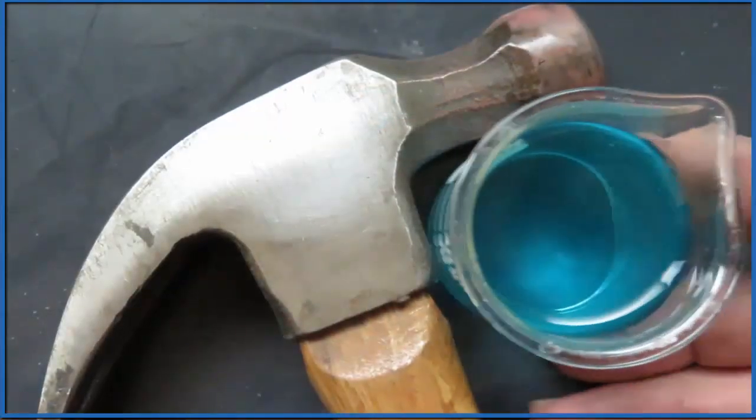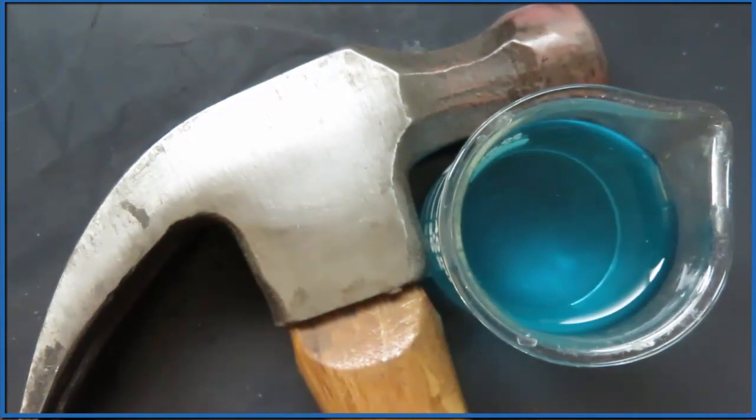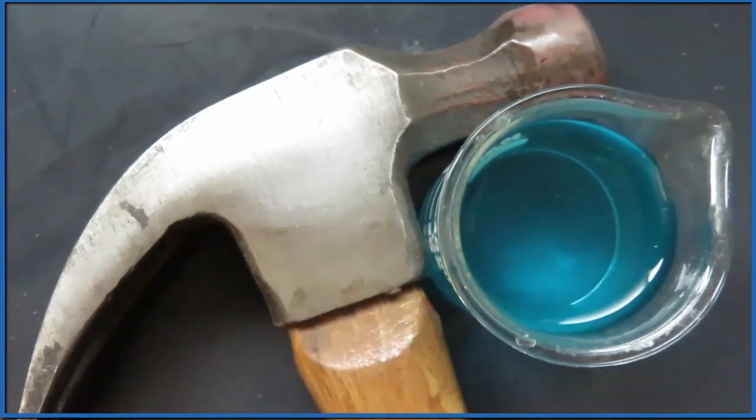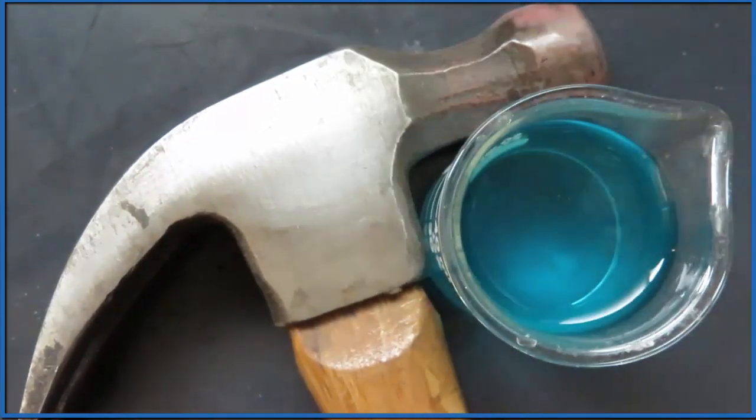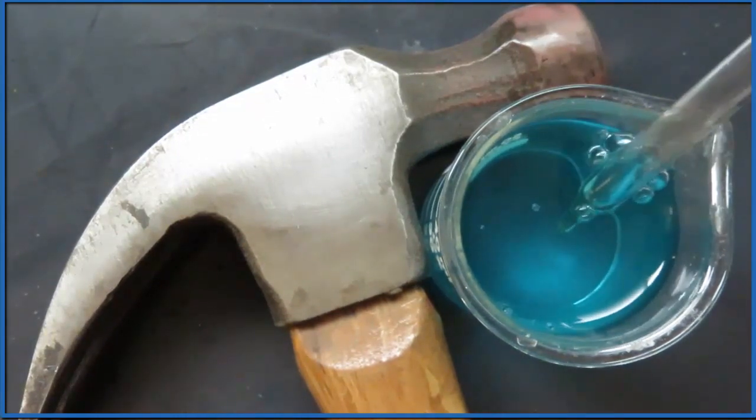The copper, now it's on the hammer. We could also put some of the copper 2 sulfate on the side of the hammer. Watch how it starts out blue and then that blue color quickly goes away.